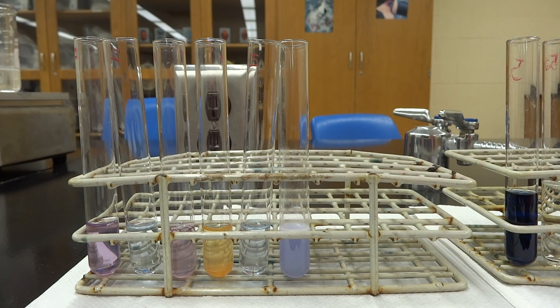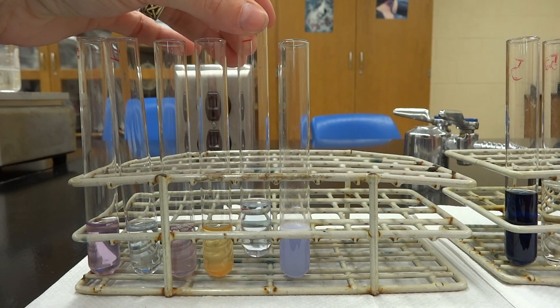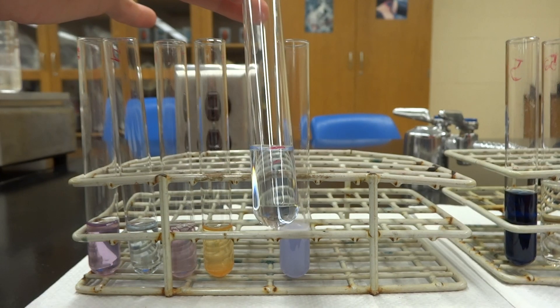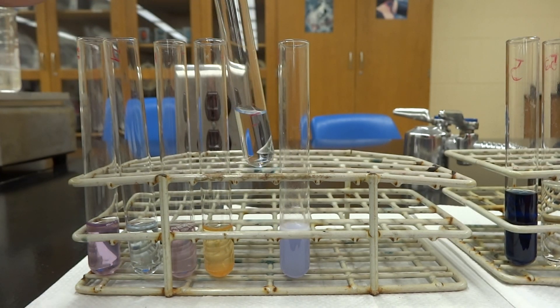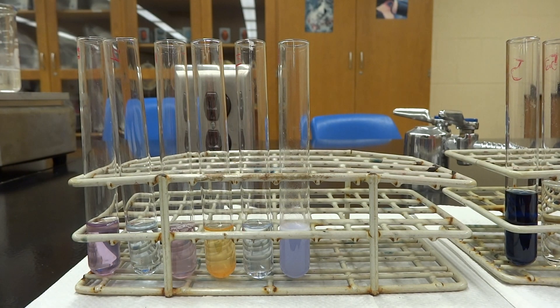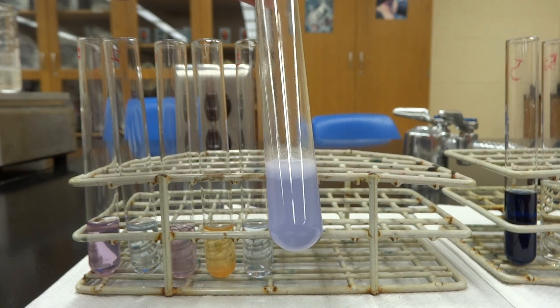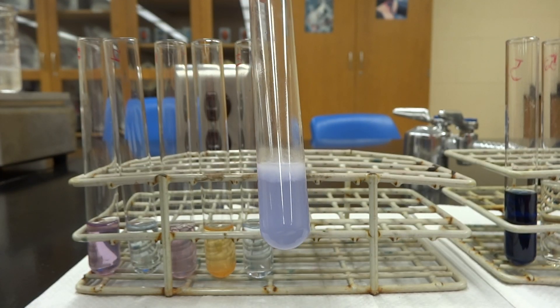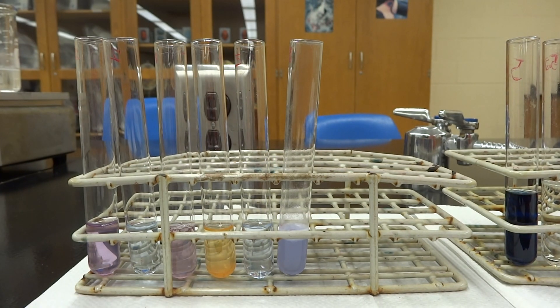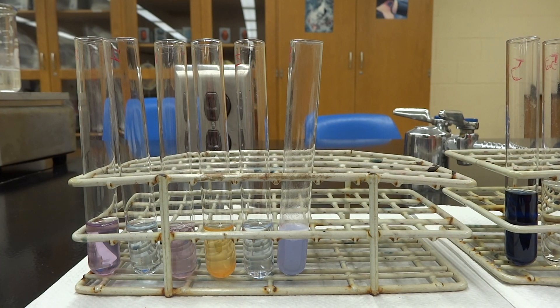Number five is an amino acid solution. Remember, amino acids are what make up proteins — they are the monomer for proteins. So they are not going to test positive as a protein because they're not assembled as one, so they test negative. And then for milk, you do get a little bit of protein showing up. Whether it is nonfat or full-fat cream, you're going to get some protein, so your milk will test positive for protein.